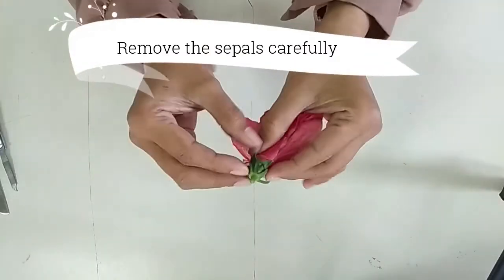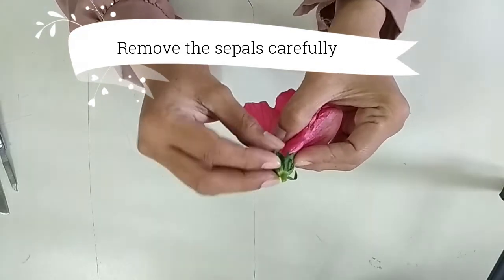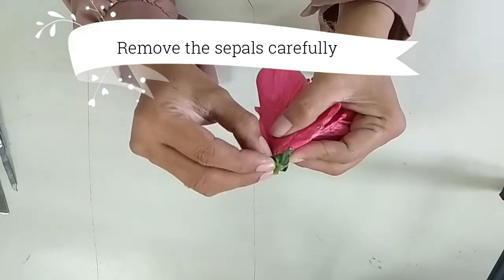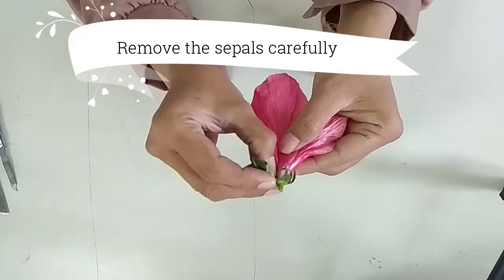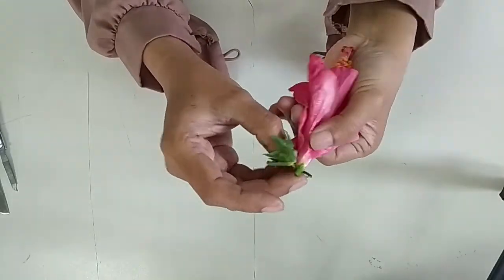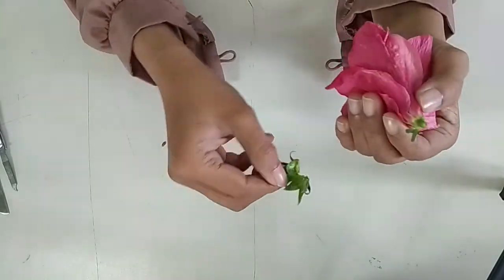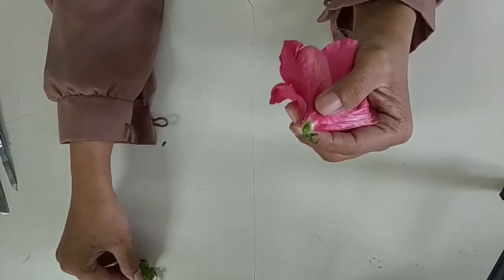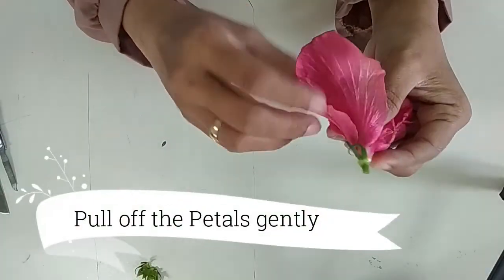Remove the sepals and petals from the flower. Sepals are the small green leaf-like structures in between the petals and the stem. Use your hand to pull each one down toward the stem. The sepals protect the bud of the flower as it develops, especially from cold or injury.